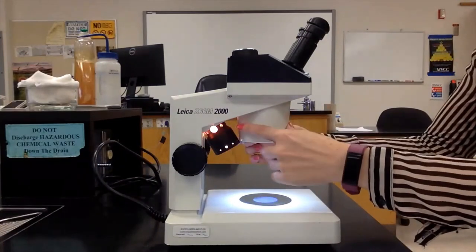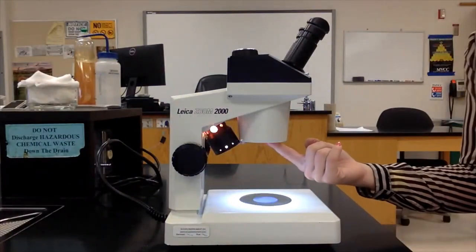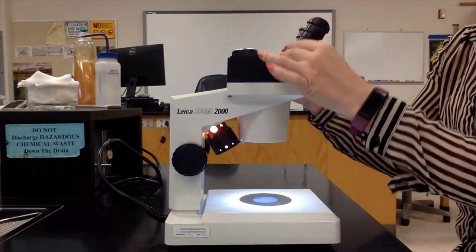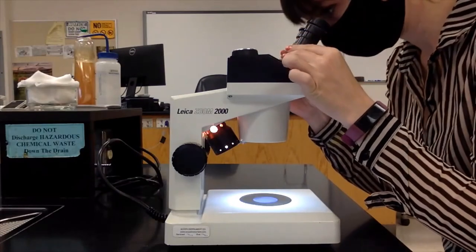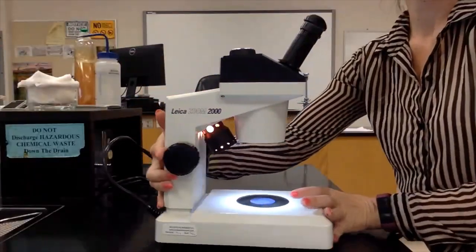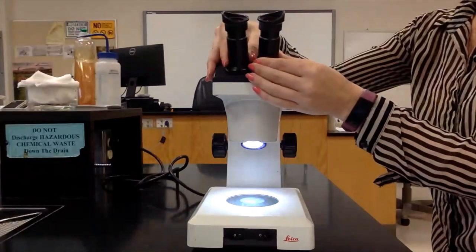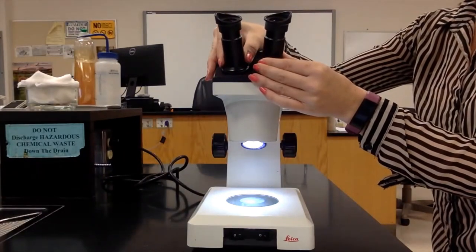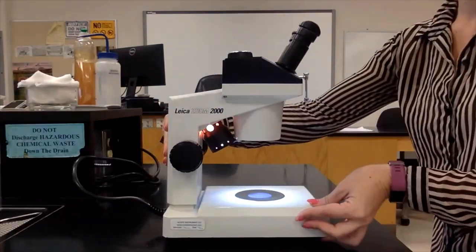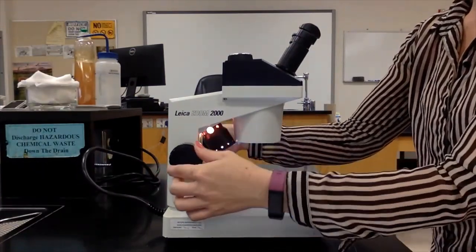We also have our shroud, and inside this shroud there is our objective lens. The shroud protects the objective lens. We have our ocular lenses here, and as you can see, by gently moving these outwards or inwards you can change the distance between the two ocular lenses so that you can properly see. This is the coarse adjustment here.